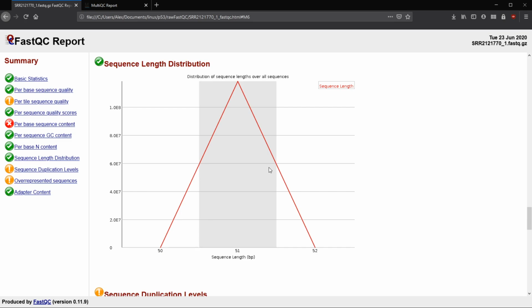But for PacBio, there can be a lot more deviation from just one. Some PacBio reads are 60,000 base pairs, but generally the average is a little bit lower, less than 10,000, between 1,000 and 10,000 are going to be most of the reads. And even nanopore, some nanopore reads can be hundreds of thousands of base pairs. So we might get a really long distribution tail for this as well.